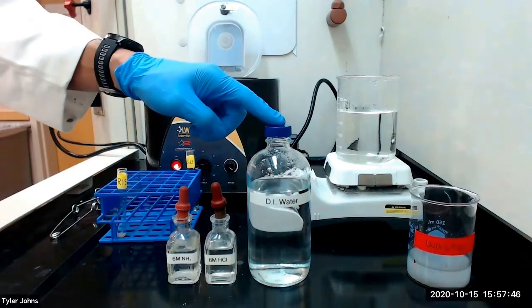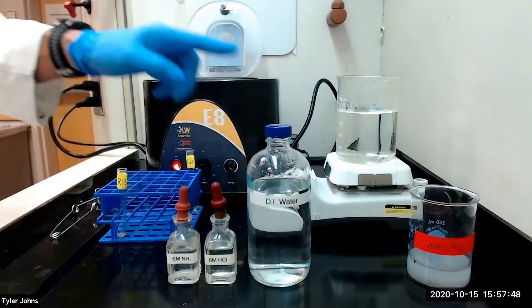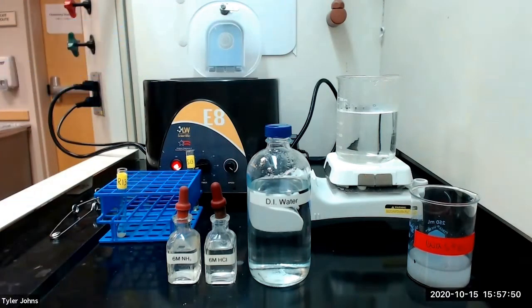We will now wash the residue with 10 drops of deionized water, centrifuge, and discard the washed liquid.